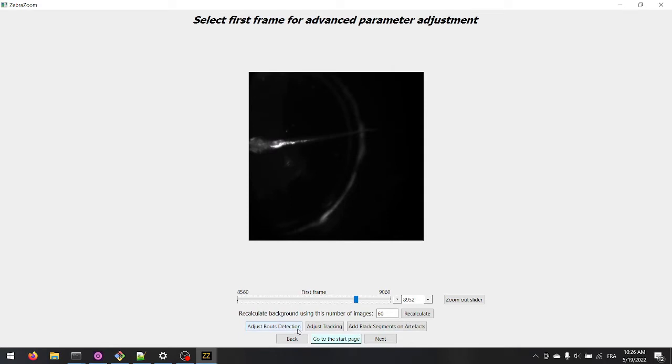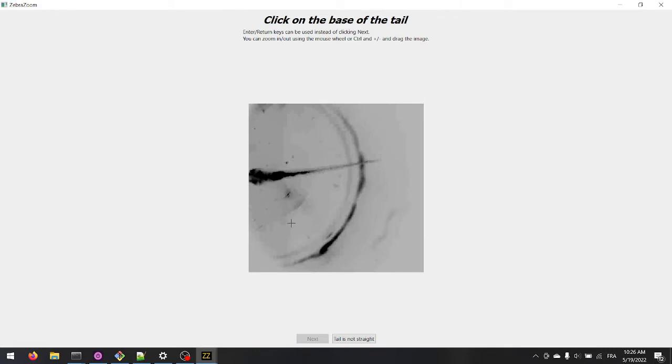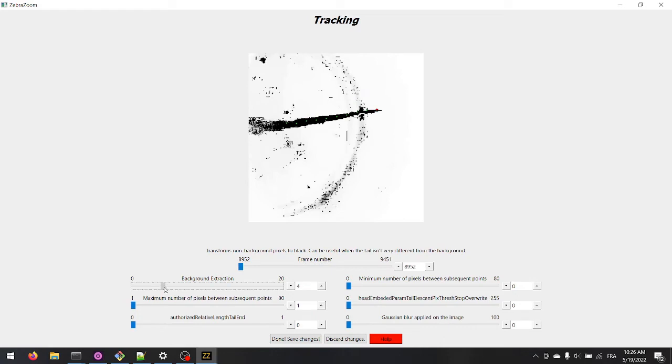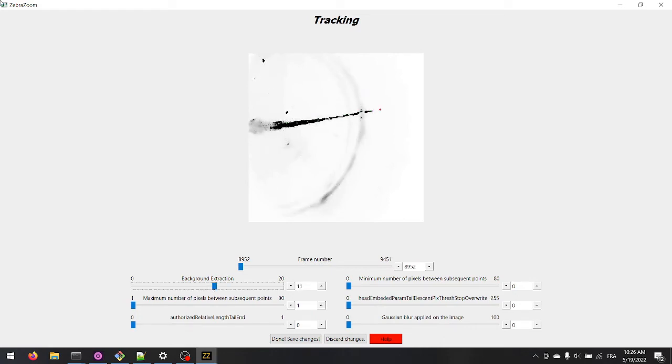Now, check the quality of the tracking. In this frame, a tracking point is on an optical artifact, forming a ring. Add some background subtraction, as this should help ZebraZoom differentiate the fish from the background.